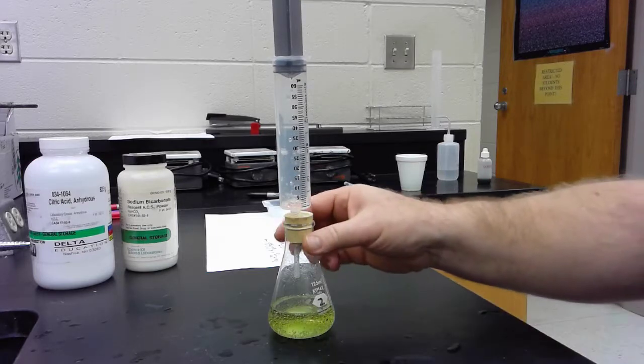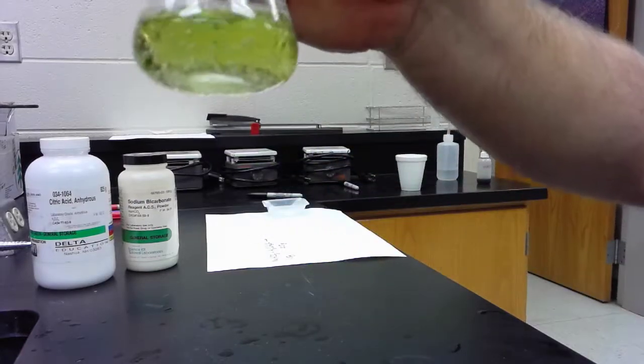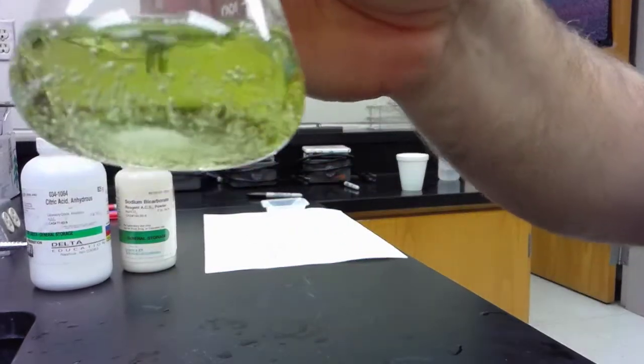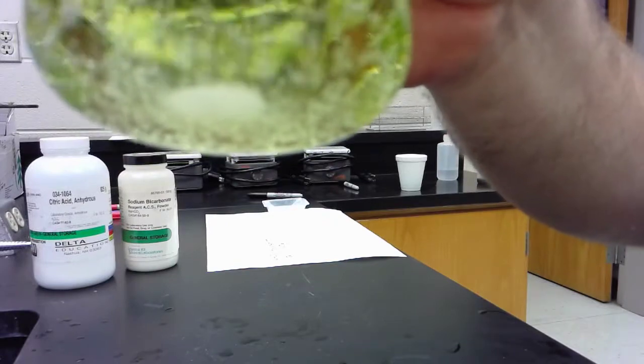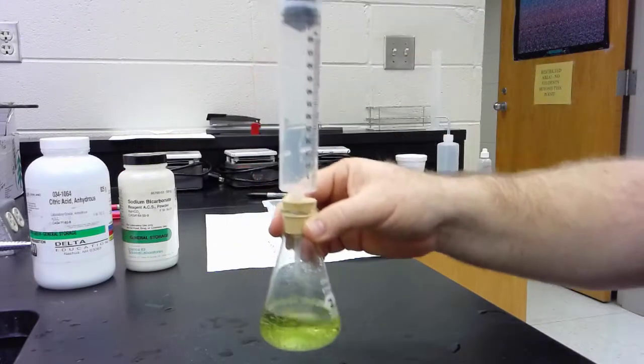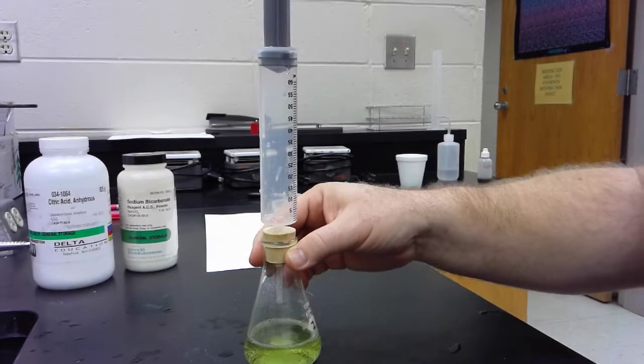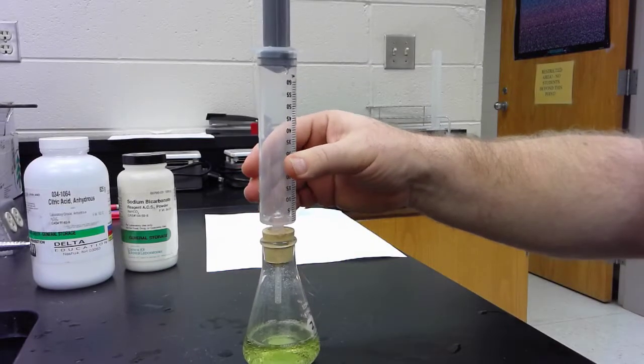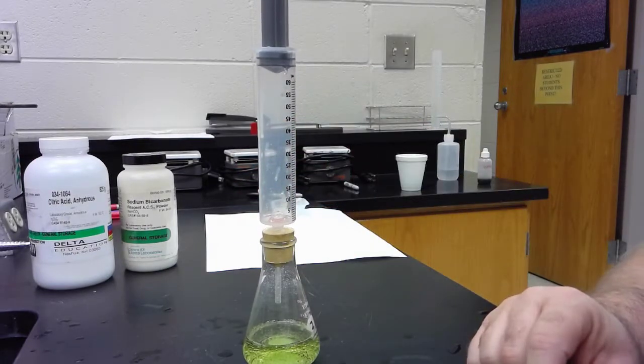Still bubbling a little bit. You can see, or maybe you can see, it may still be a little bit unreacted in the bottom of one or the other of the chemicals. We can find that out later. But there we go. We've collected a pretty good amount of gas.